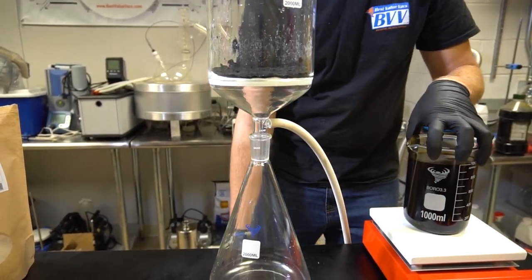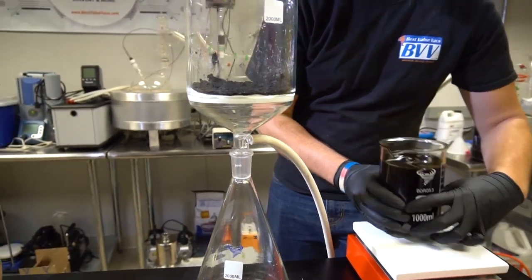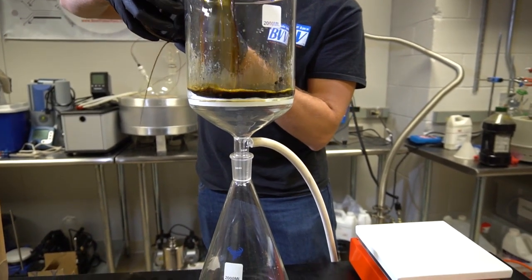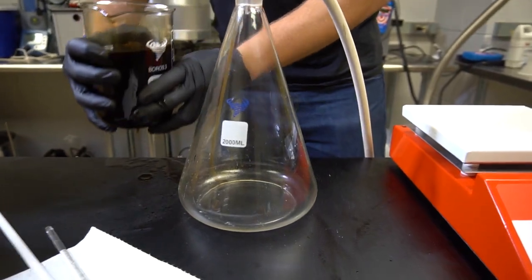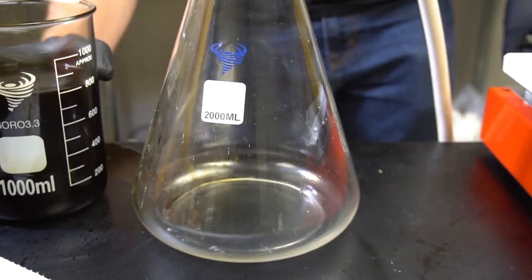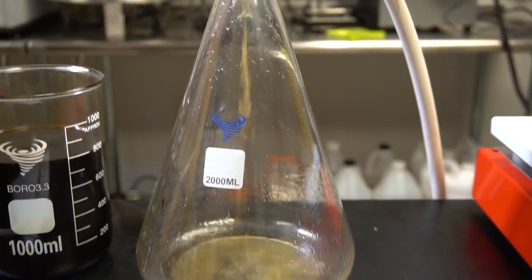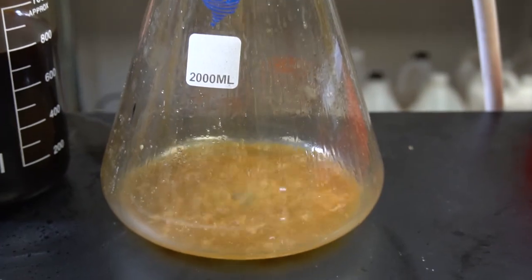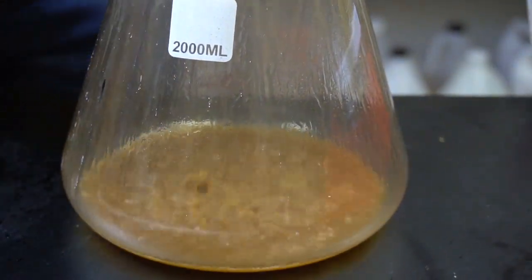First, I'll turn on my vacuum pump. Now I'm just going to pour this right in the top. You can see already the color is much clearer than it was before it went into the top.